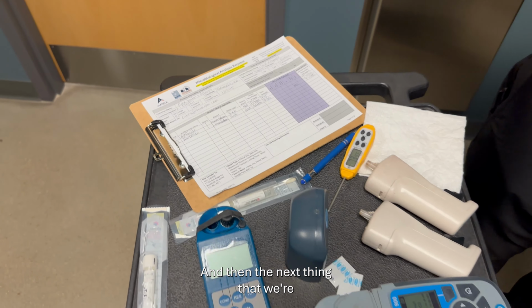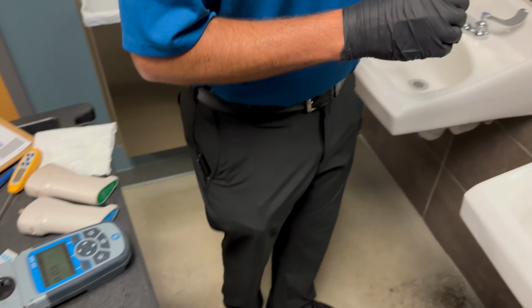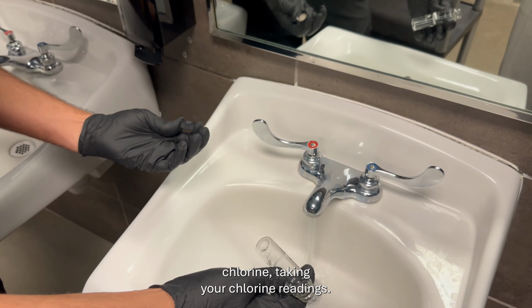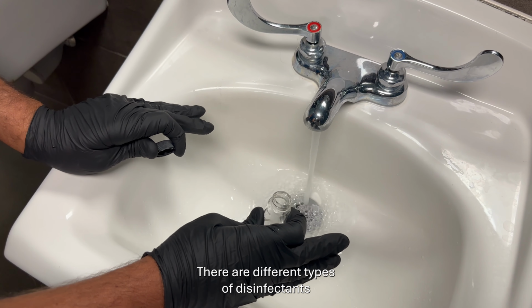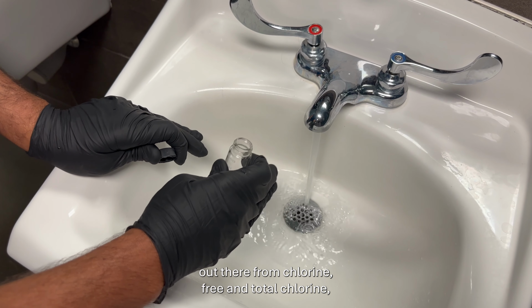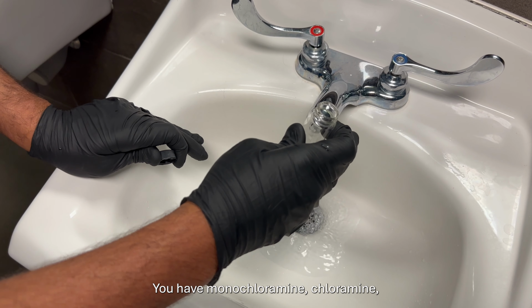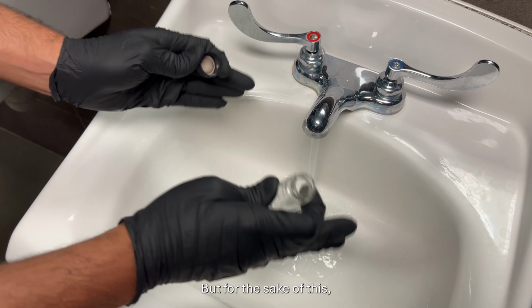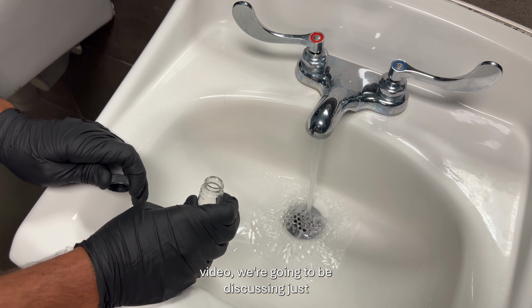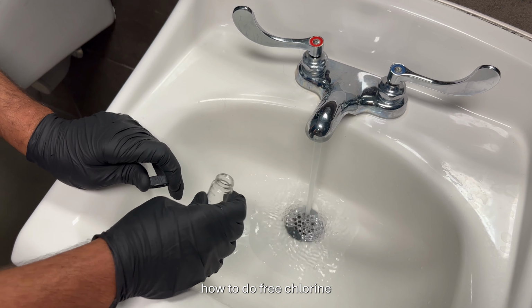And then the next thing we're going to discuss is chlorine, taking your chlorine readings. Everyone's going to be different. There are different types of disinfectants out there, from chlorine, free and total chlorine, to monochloramine, chloramine, and chlorine dioxide. But for the sake of this video, we're going to be discussing just how to do free chlorine.